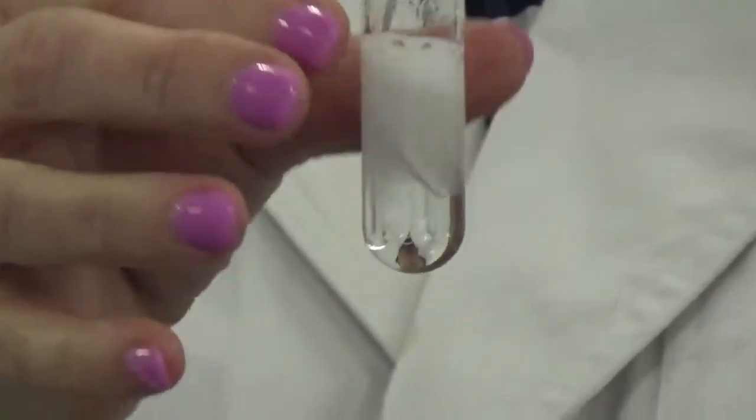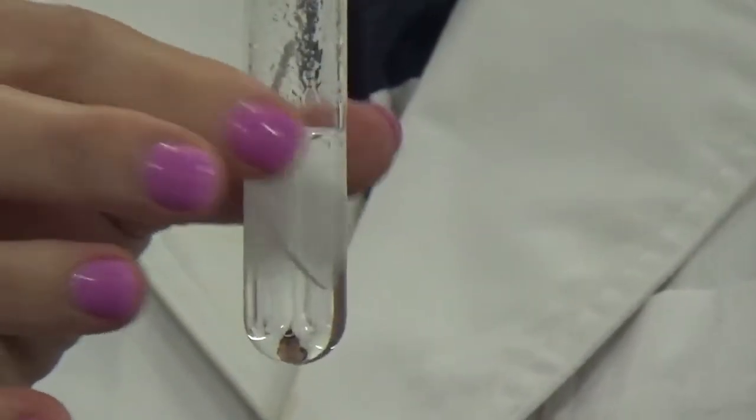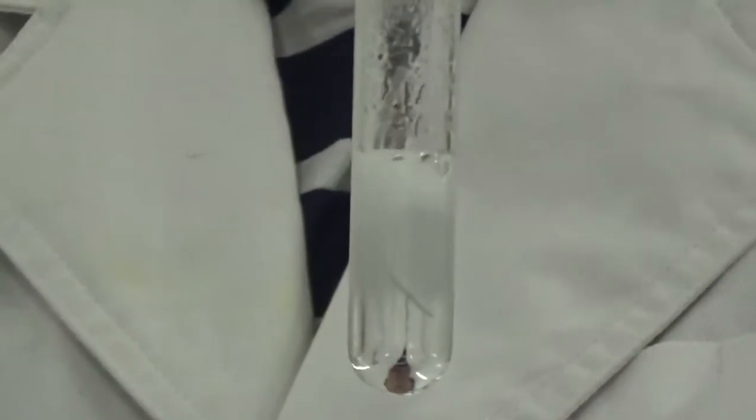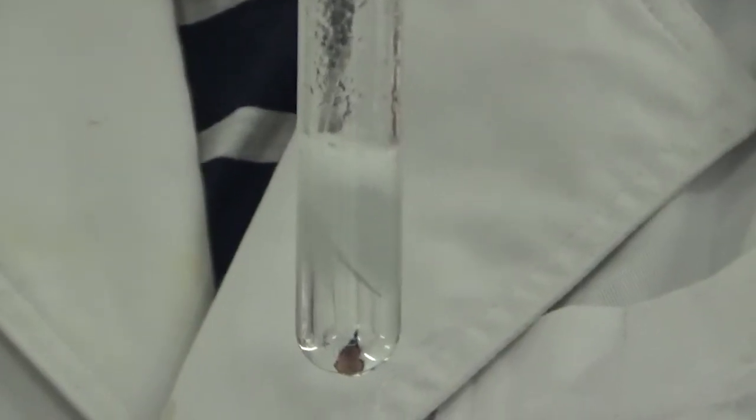I'm just going to try something. That's getting really hot. That test tube's getting really hot with this reaction. I don't want to touch it for too long.